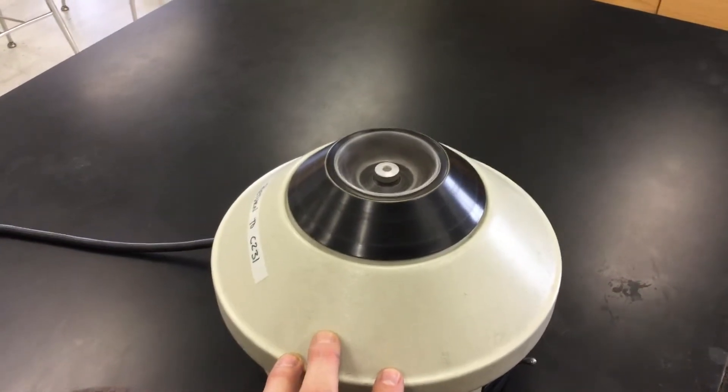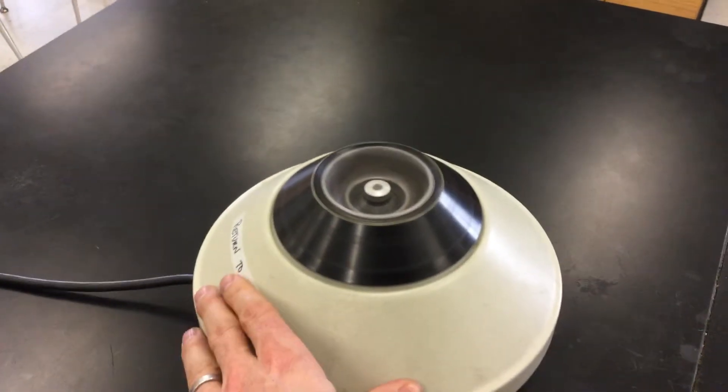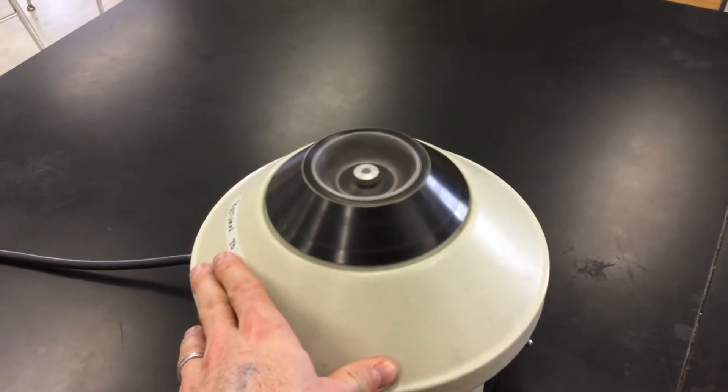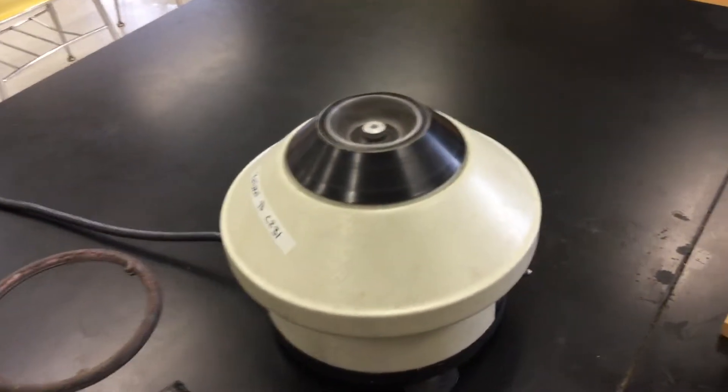And when you see this machine, it gets up to about 100 miles an hour. It's now spinning those chemicals. I'm holding it because if I don't, you can see it starts to move.